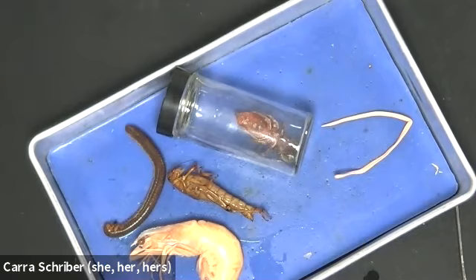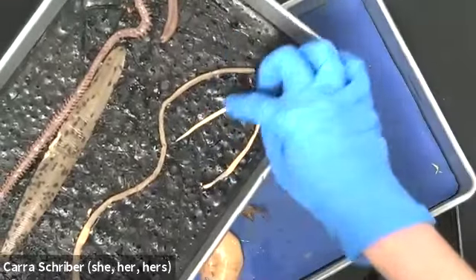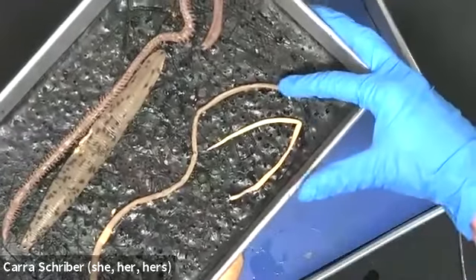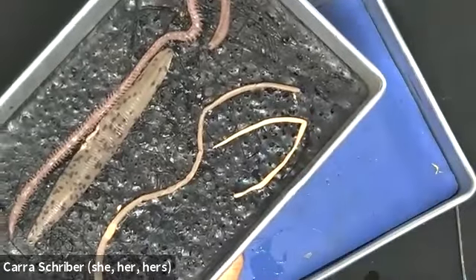What I'm going to do is add a second version where I do a dissection of the roundworm and our earthworm, roundworm versus earthworm. And so what we'll do is a side-by-side dissection of the earthworm and the roundworm, and we'll see how the organ systems look different, right? So we knew that the roundworm has a pseudocoelom and the earthworm has a coelom. And so we'll see what that looks like internally when we do those side-by-side dissections.